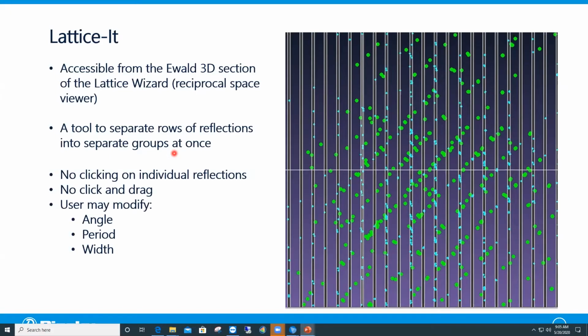So there is no need to click on the individual reflections to put them in a separate reflection file. There's no need to click and drag on top of rows of reflections either. These two things would be quite time consuming and tedious, of course. The last thing is that once the bars have been created, you can slightly modify their tilt angle, the period between consecutive bars, meaning the distance between consecutive bars, and you can also modify their width.